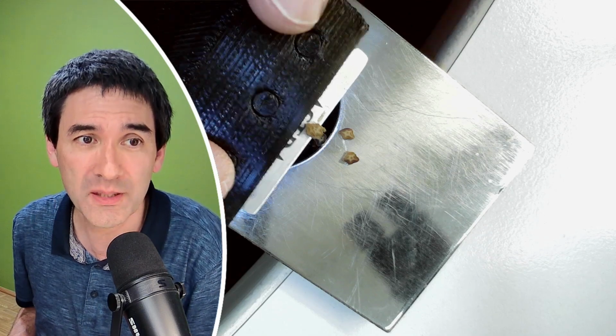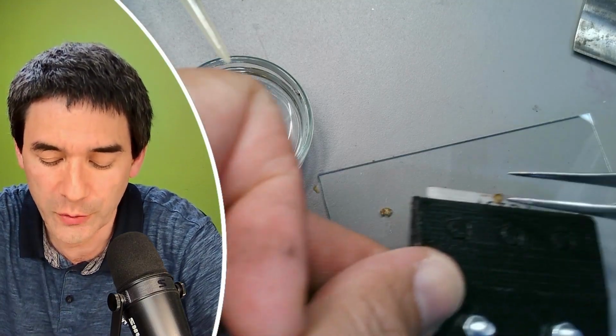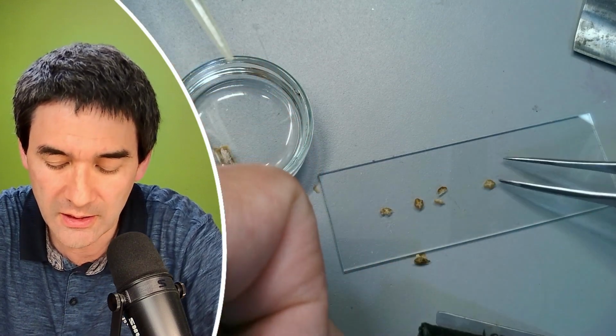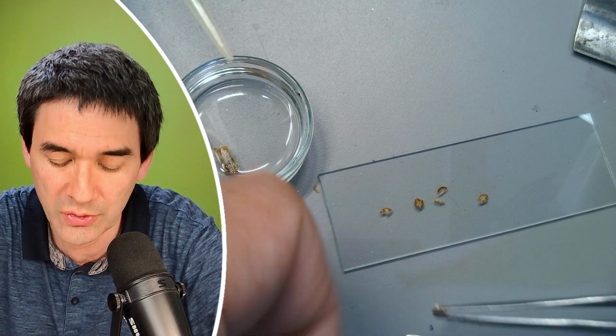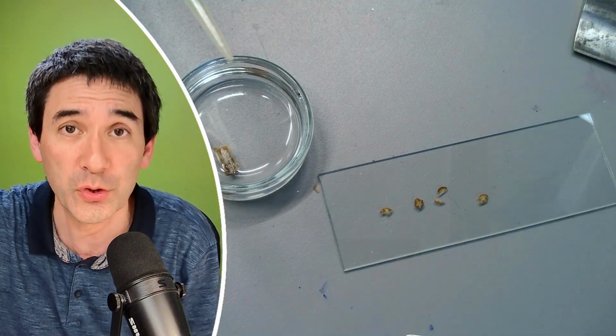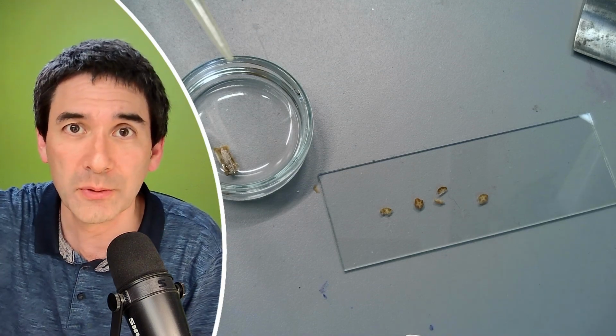But let's put some of those now under the microscope here as well. I mean, I just said under the microscope, we have to put it first, of course, on the slide. Here it is. I'm now not going to use a cover glass. I'm just going to have a first look, simply like this, and we're going to see if we're able to see some kind of a difference.